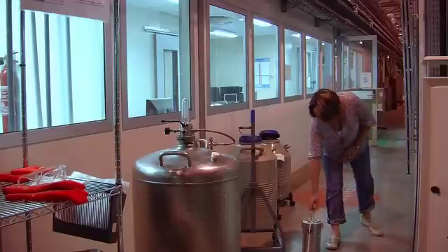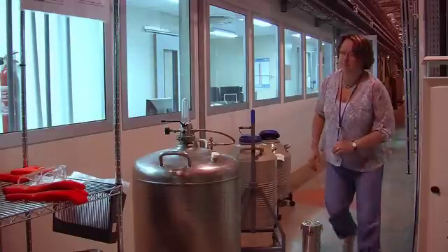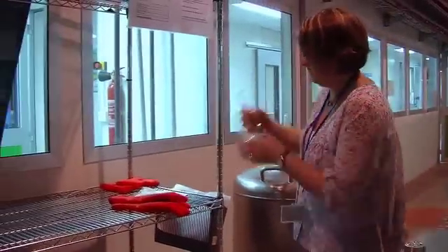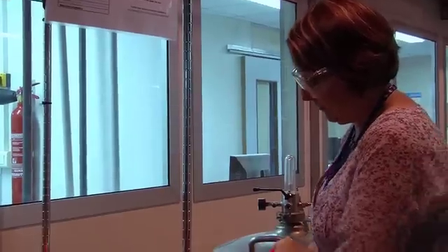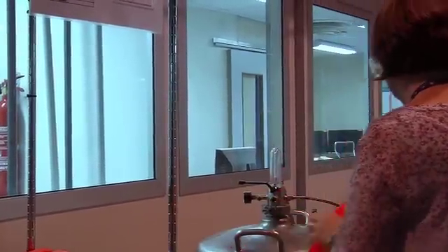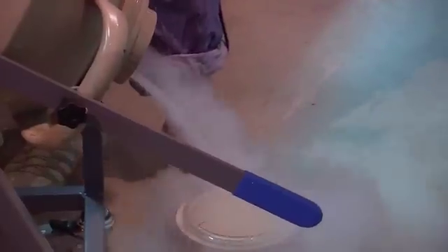A wide range of techniques is open to industry at the ESRF. Dr Elspeth Gordon, industrial liaison scientist, will give us an insight into macromolecular crystallography, also called MX.